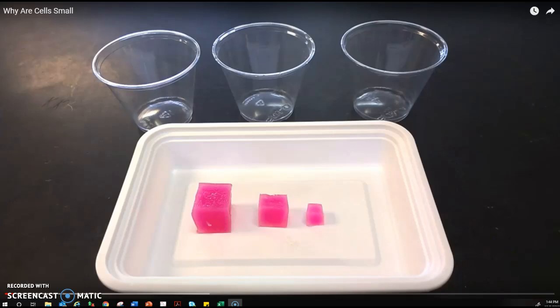If we take a look at what we have in front of you, you have three cubes. Each cube is a piece of beetroot, which is a vegetable. Naturally it's this bright pink color just like this.